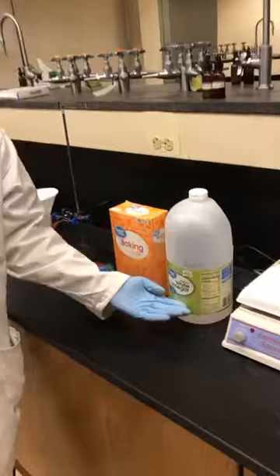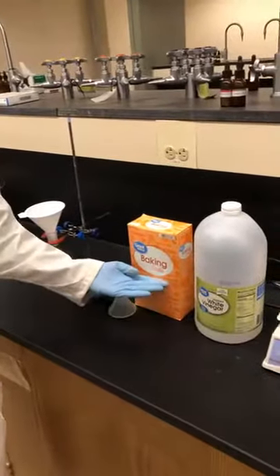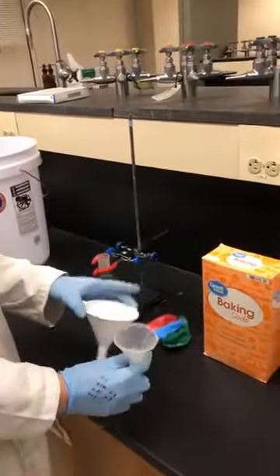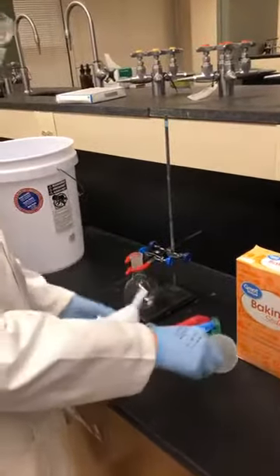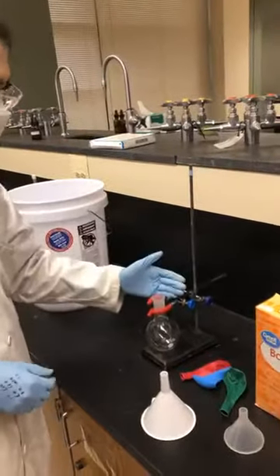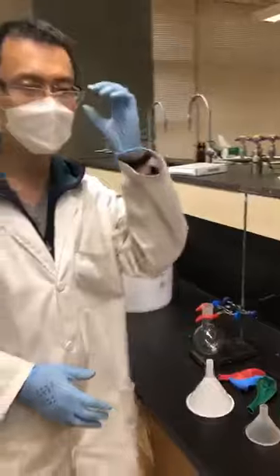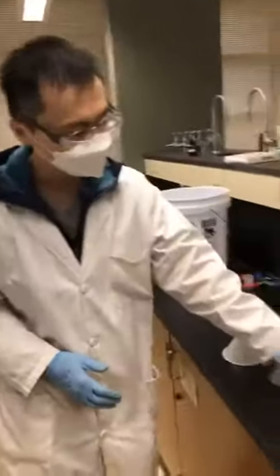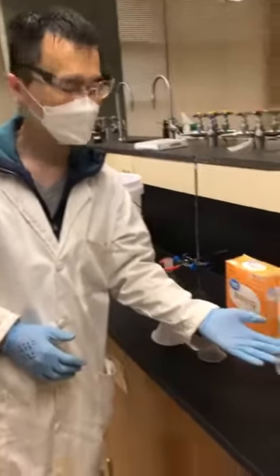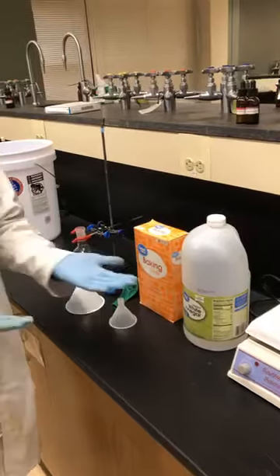First: what is this in the kitchen? This is white vinegar — and baking soda, also from the kitchen. We need two plastic funnels, balloons, a holder, a clamp, and round-bottom flasks. But first, let's ask a question: vinegar and baking soda — what are those chemicals or their compositions? What is vinegar? What is baking soda? You saw them in the kitchen, but do you know what's inside?